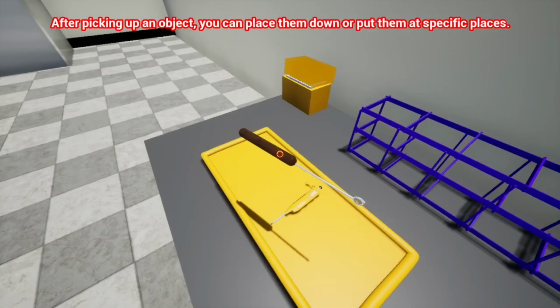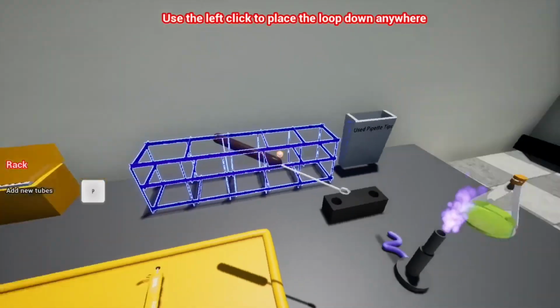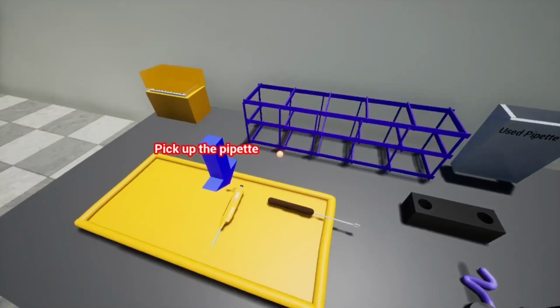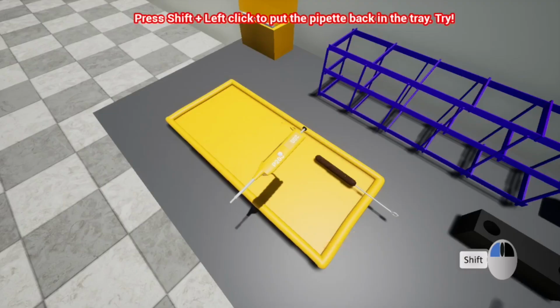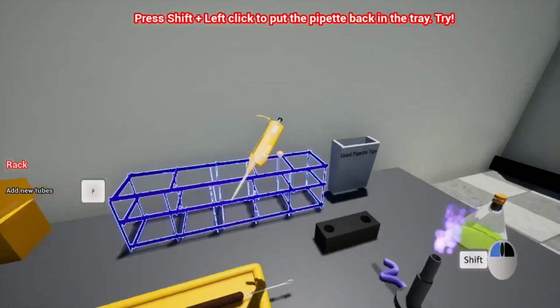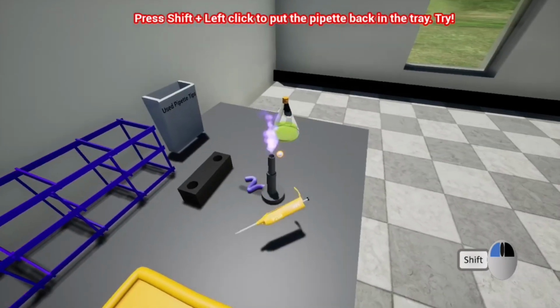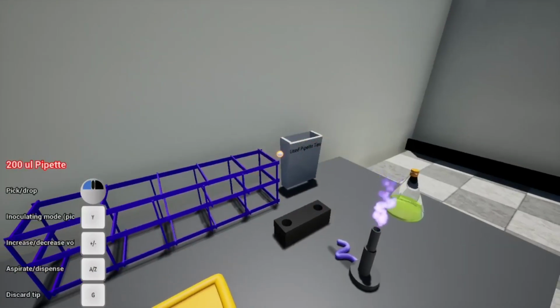After picking up an object, you can place it down or put it at specific places. Let's try this. Use the left click to place the loop down anywhere. Let's place it down over here. Now pick up the pipette. Press shift and left mouse button to put the pipette in the tray. So you can point towards the tray, and if you just click like this, it's gonna fall wherever you want it to fall. But if you press shift and then click, it's gonna go back in the tray.